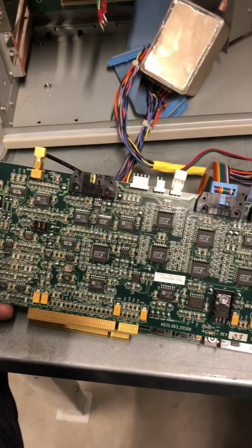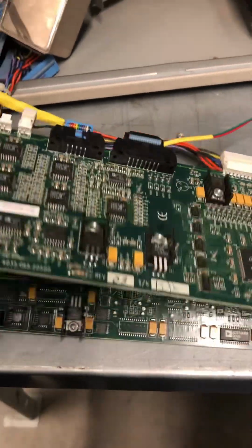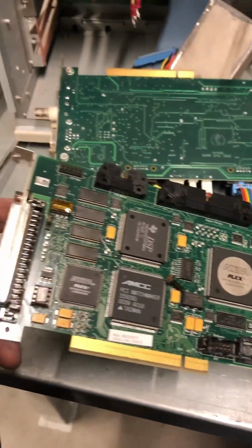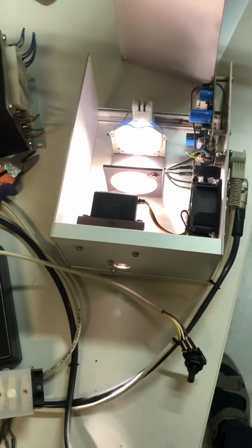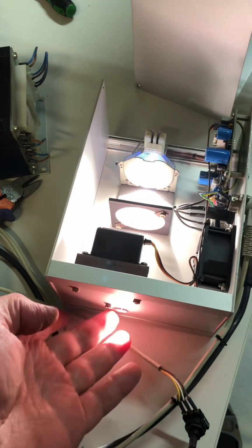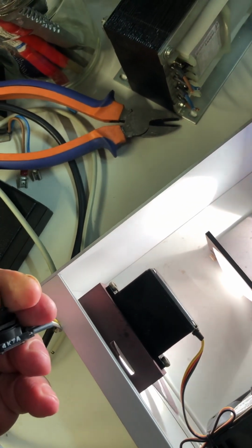Input with many amplifiers and the multiplexers or something, I don't know. And then here is the digital signal processor. This is a Pentium 2 processor. Illumination module for optical fiber. Here is the fiber output. And we have a servo motor with a potentiometer that can close and open the shutter.